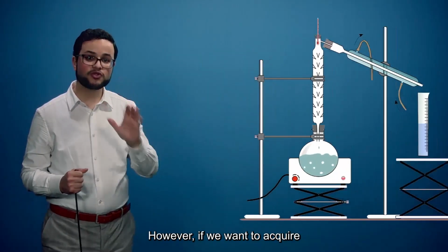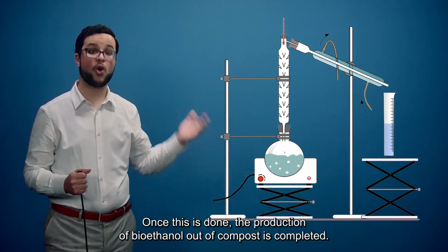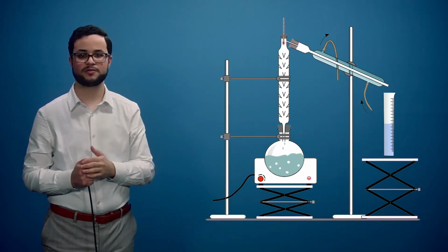However, if we want to acquire a quasi-pure solution of ethanol, we still have to perform a distillation. Once this is done, the production of bioethanol out of compost is completed.